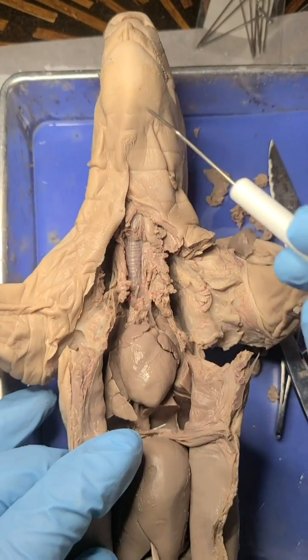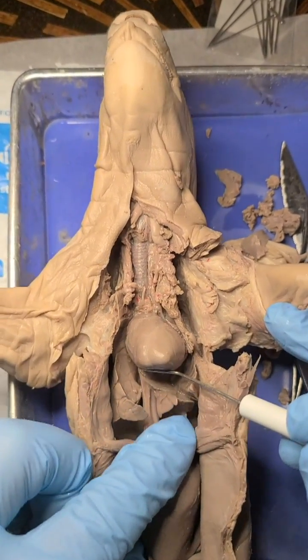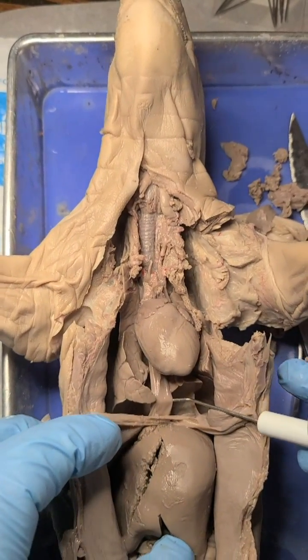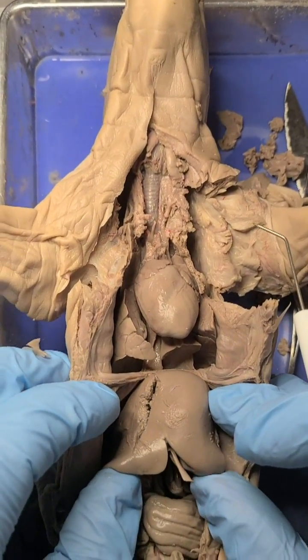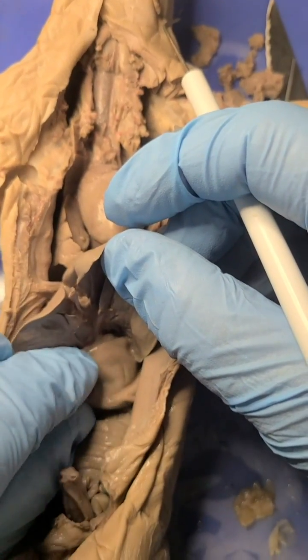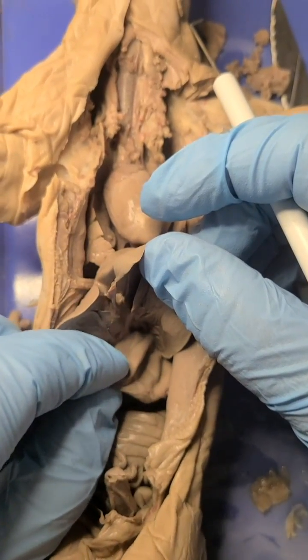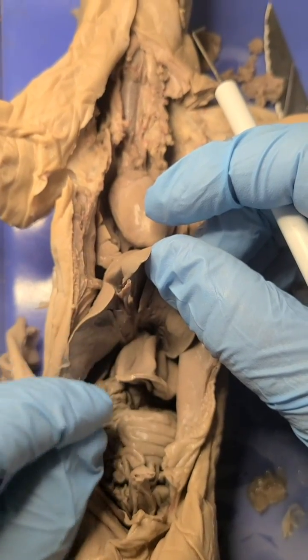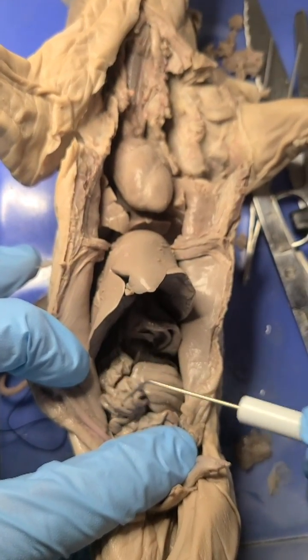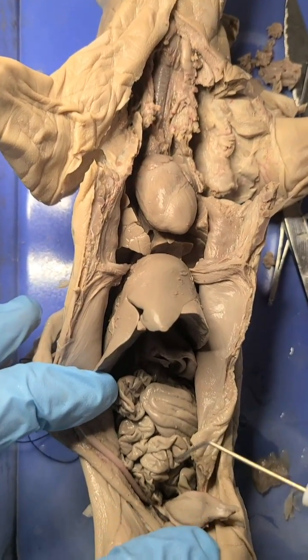For digestion, the animal eats food, it goes down the esophagus, and if we look underneath the heart, we can see this structure right here — that flexible tube is the esophagus. We follow that underneath this large organ, which is the liver, and if we pick up the liver, we'll see this bag here, and that's going to be the stomach. The contents of the food will first be digested in the stomach, and then dump out into the small intestine, which connects up to the large intestine, and then out of the animal.